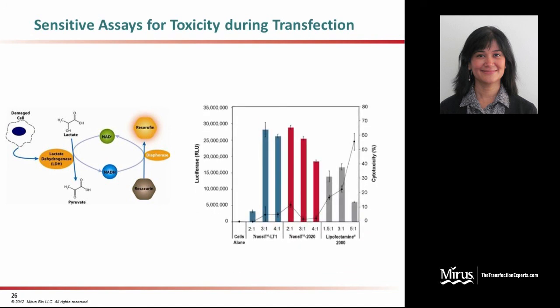Here you can see a data set of HeLa cells that have been transfected with a luciferase encoding plasmid. This data shows expression and also the corresponding toxicity values in terms of the LDH release from the matching cell supernatants. Again, as you can see here, with lipopolyplexic formulations such as Transit LT1 and Transit 2020, you see good expression in these HeLa cells and correspondingly low toxicity. However, with liposomal formulations such as lipofectamine 2000, the expression of luciferase is twofold lower, at least, and also the levels of toxicity are very high, close to 60% compared to less than 10% with the LT1 and 2020 formulations.